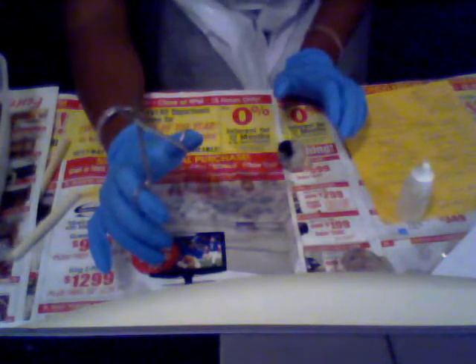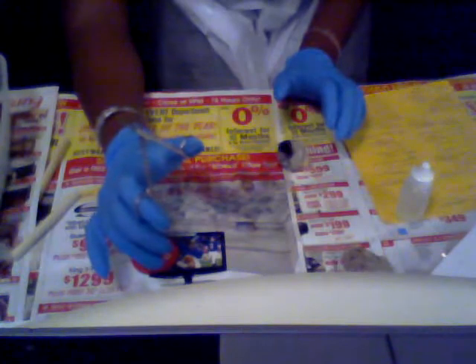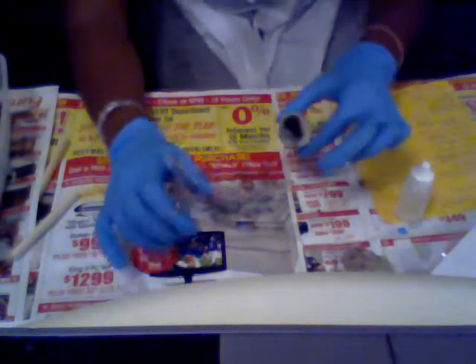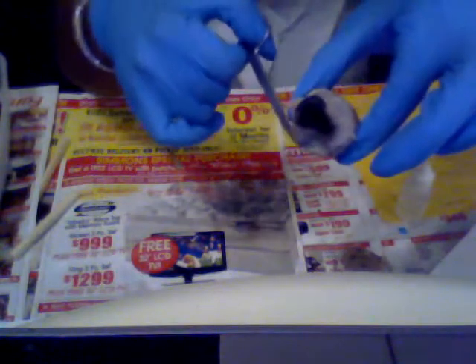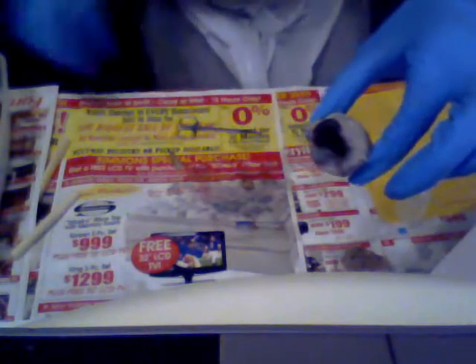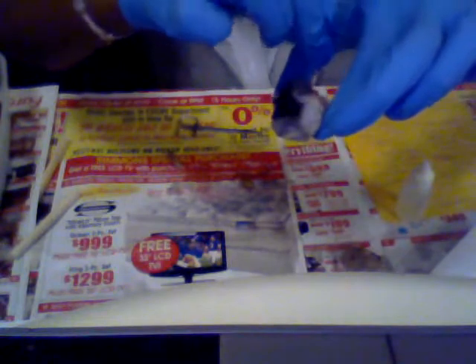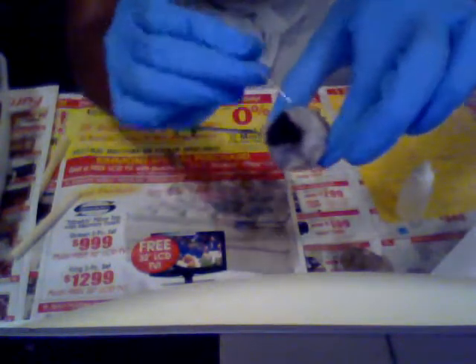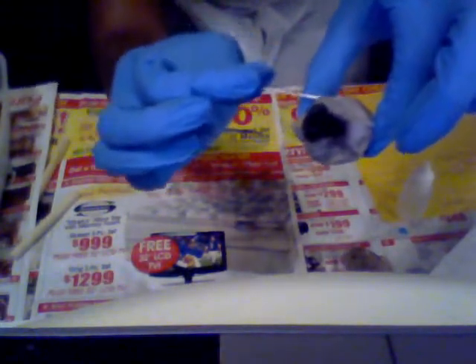Next up is the sclera. The sclera is basically the white part that surrounds the eyeball — all this right here. This is the sclera. I'll just show it to you — this white part right here, this is the sclera.